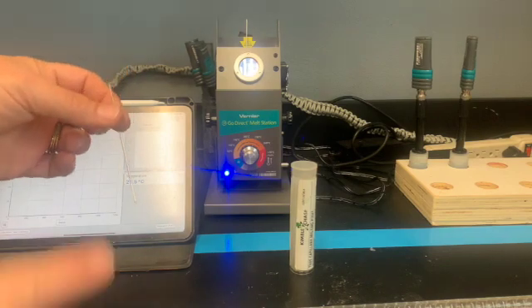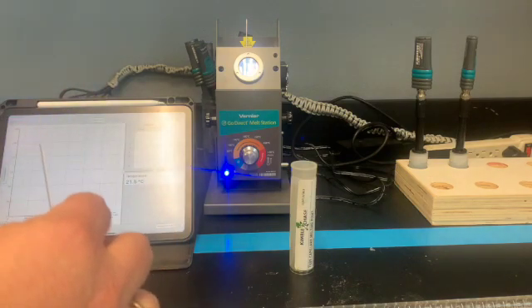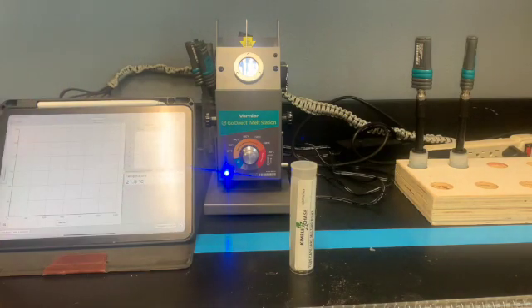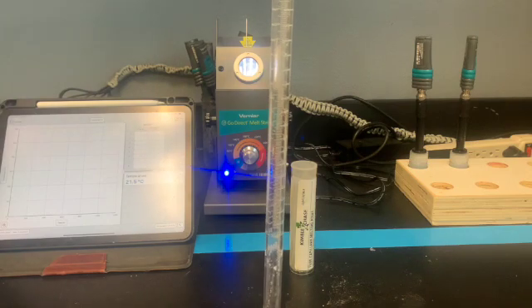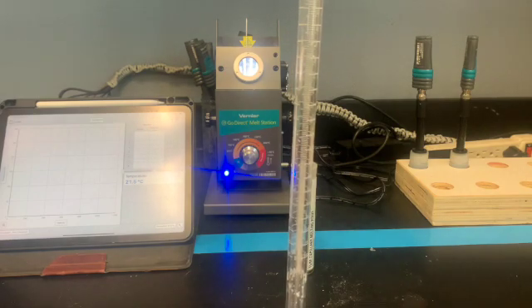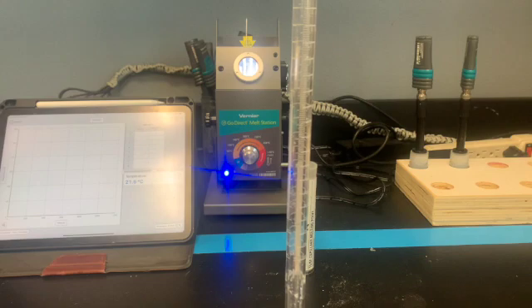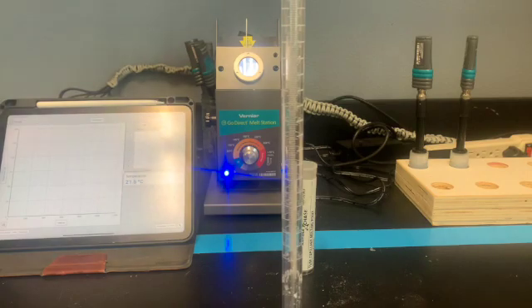Okay, the next phase is to get your capillary tube set up as I do. What you're going to do is obtain a capillary tube and obtain your sample, and you've got to get some in the tube. Then I have an old burette stick here, and I'm going to drop my capillary tube down a few times, and that helps it to sit down in the bottom of it. I don't need a whole bunch of it. I just need enough that when I'm looking through here, I can see what's going on.